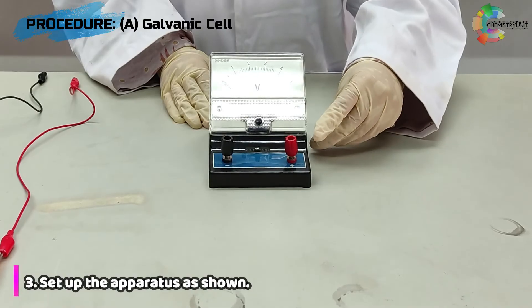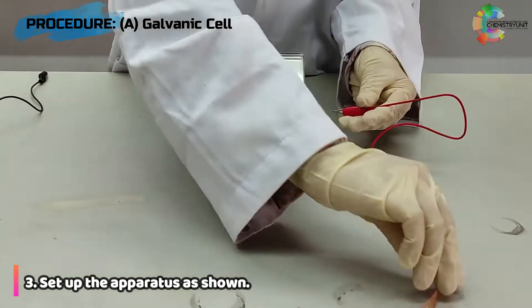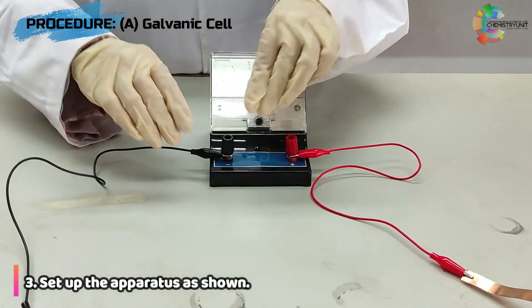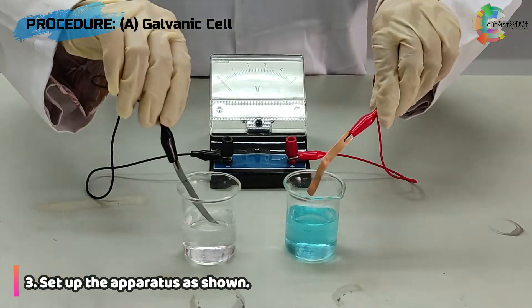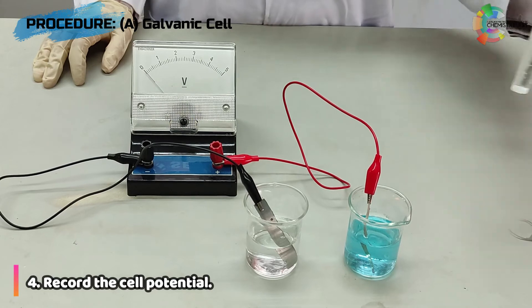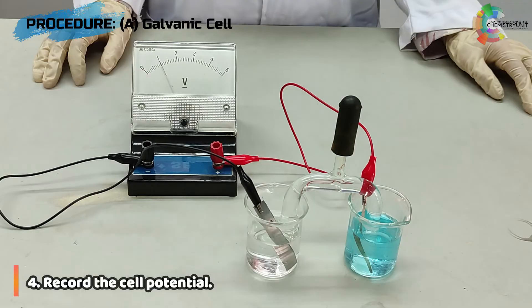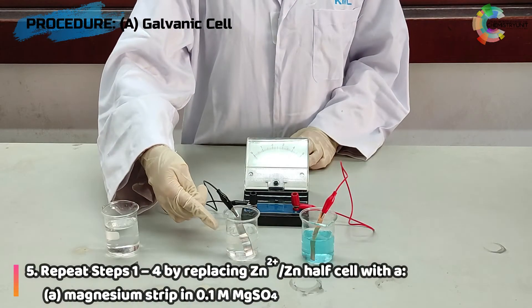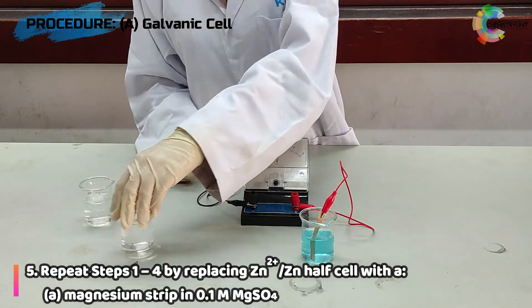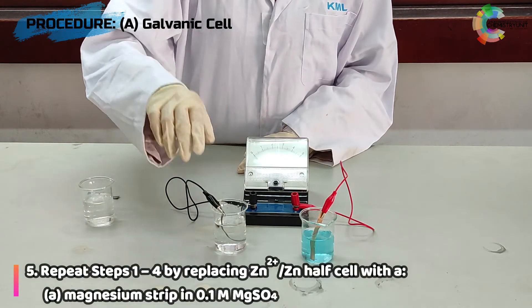Step 3: set up the apparatus as shown in the video. After all the apparatus is completely set up, record the cell potential. Repeat steps 1, 2, 3 and 4 by replacing the zinc half-cell with magnesium strips in 0.1 molar magnesium sulfate solution.